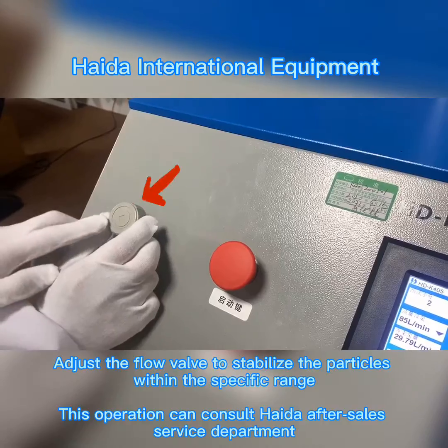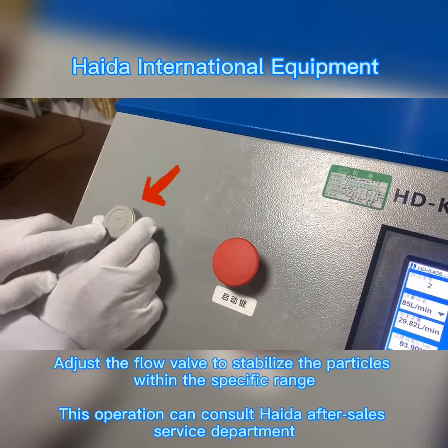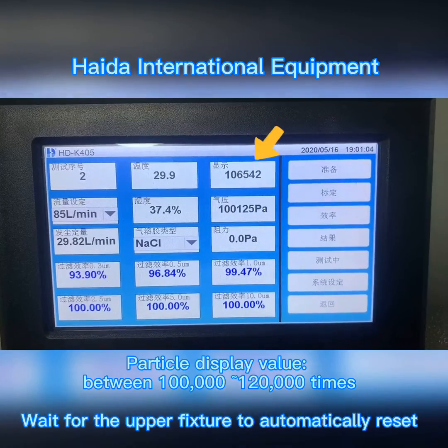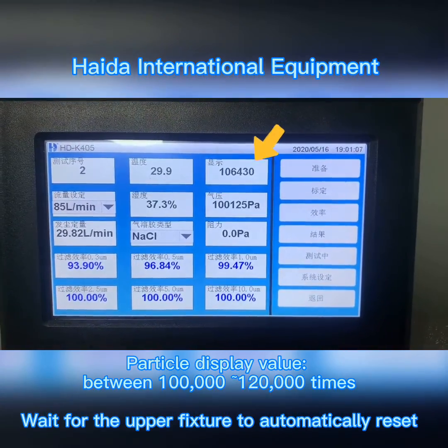Adjust the flow valve to stabilize the particles within the specific range. Particle display value should be between 100,000 and 120,000 counts.